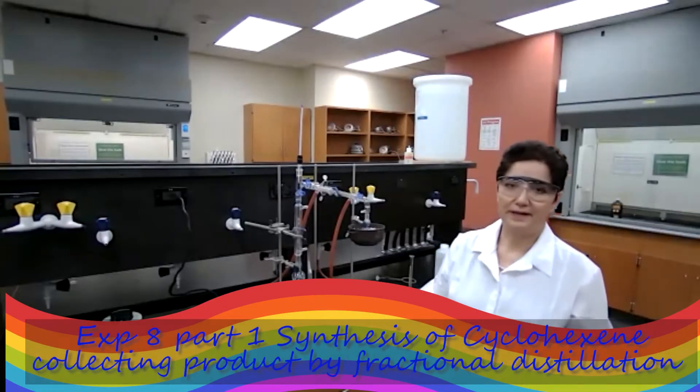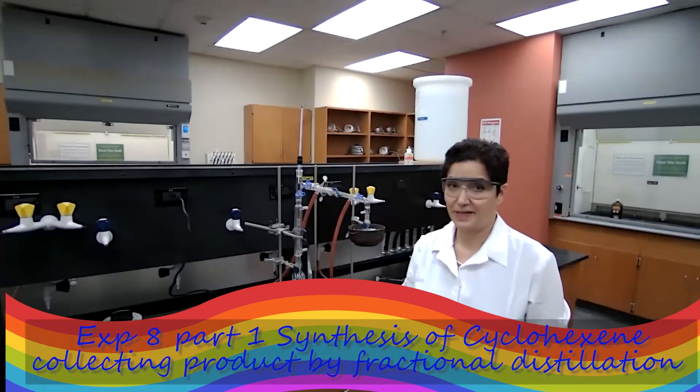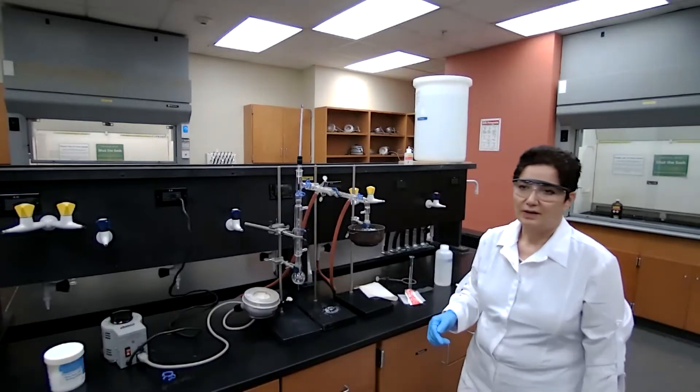Hi, Dr. Mamari. Again, we are doing experiment eight, performing experiment eight, which is synthesis of cyclohexene.